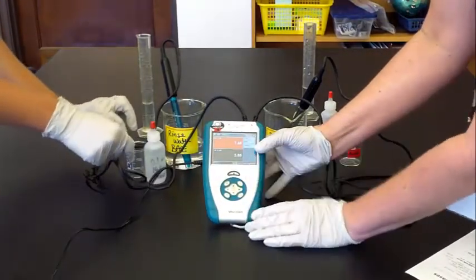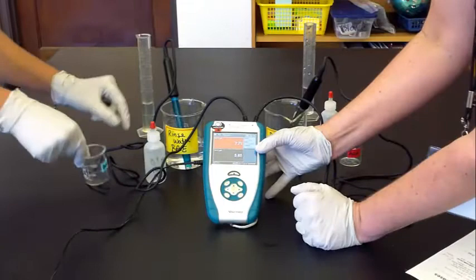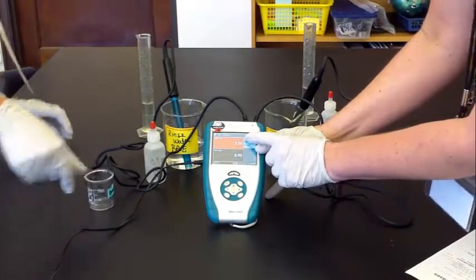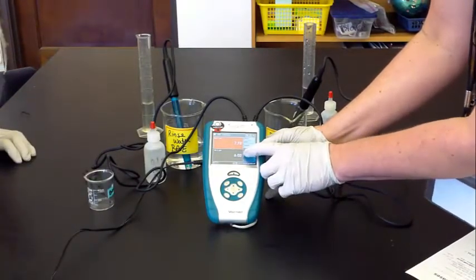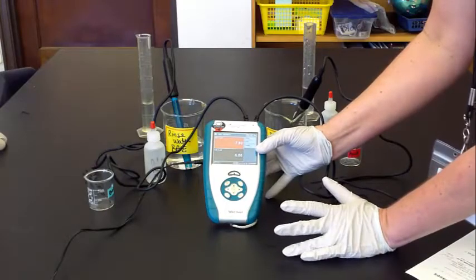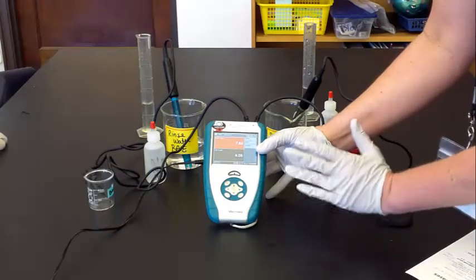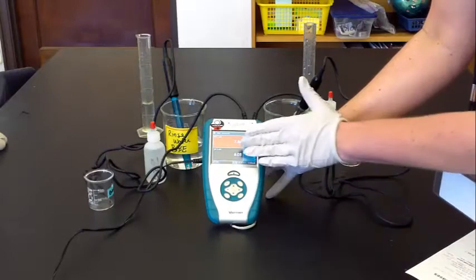Now we're not going to worry about the numbers. For example, we're in distilled water—one is reading 7.746, the other one's reading six. For this lab, we're going to focus on the change: zero to 30 drops. So don't worry about what this says in comparison.